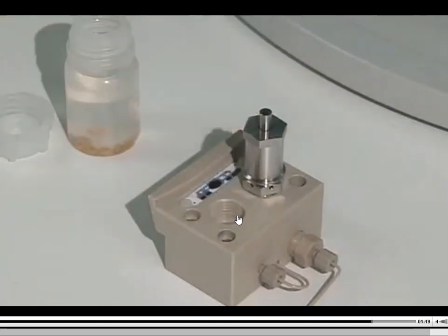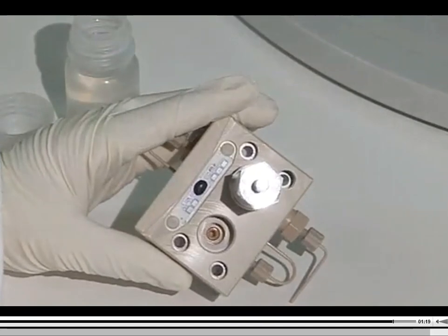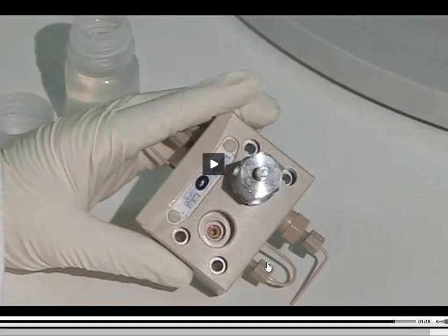The issue here, though, is if you seat the seal in there the wrong way the first time, then you will have to take it back out and throw it away. Normally, you don't get a second and third chance with the way that these are made. So if you don't do the job the proper way the first time, then these seals need to be thrown away, garbaged. Don't use them again. Don't save them for any kind of purpose. And then you need a new one to go on in its place.